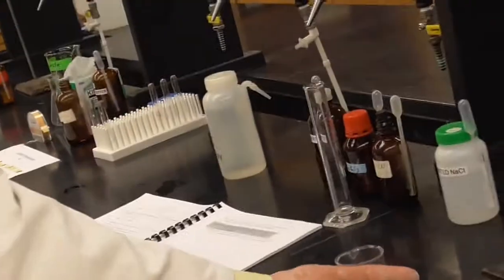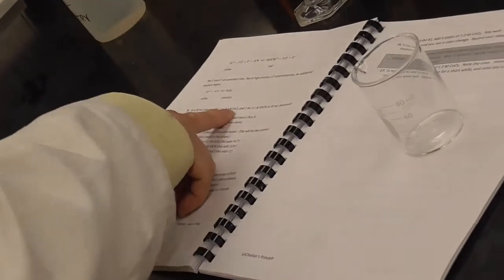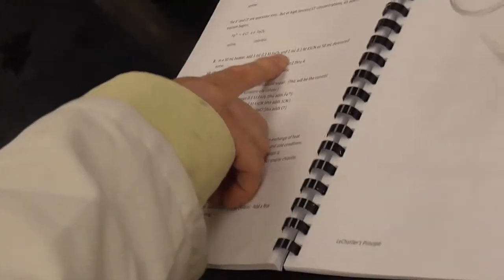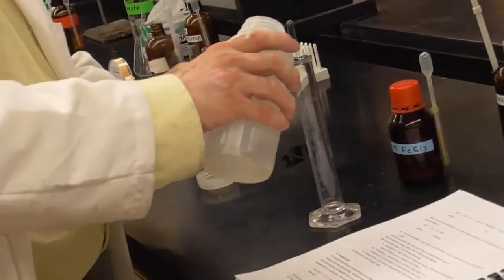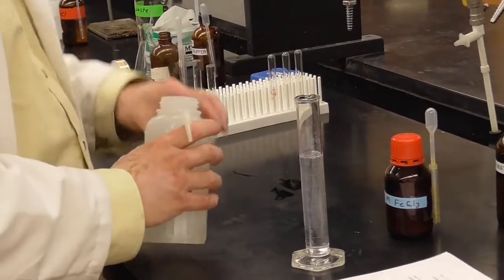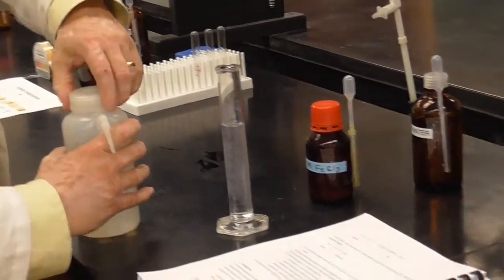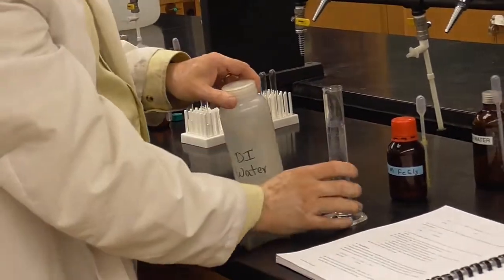Okay, step 1, it says in a 50 ml beaker, we have a 100 milliliter, that's fine. Let's go here, it might be easier to see. It says combine 1 milliliter of the iron 3 chloride, which I've got here, the potassium thiocyanate, which is there, with 50 milliliters of water. All right, so let's start with the water. Let's pour this over. We don't need to be terribly precise here. That's 45-ish. Let me just count it down. Get down even with your eye so you can see what's happening. And there's just about 50.